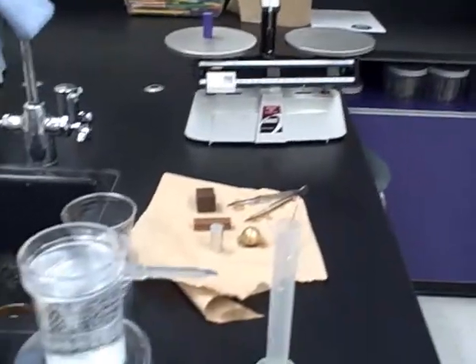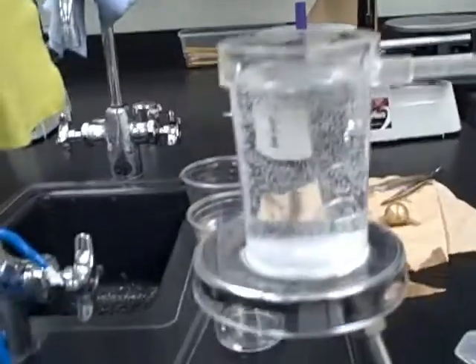All right, welcome back ladies and gentlemen. Today we're going to be practicing calculating density by getting the volume of objects by using Archimedes overflow can, how we determine the volume of an irregularly shaped object.